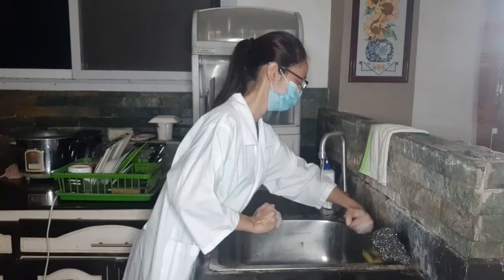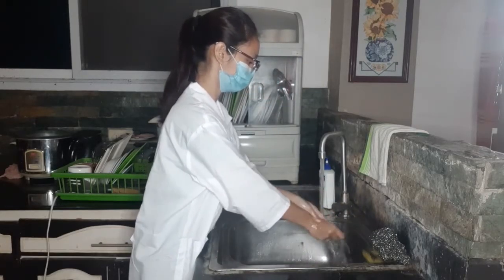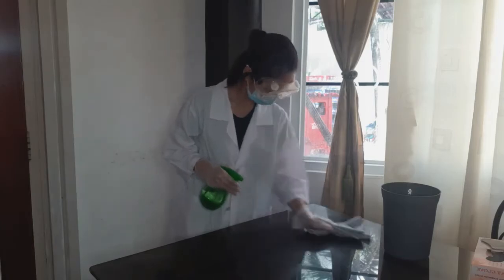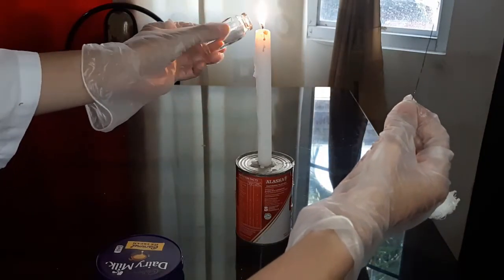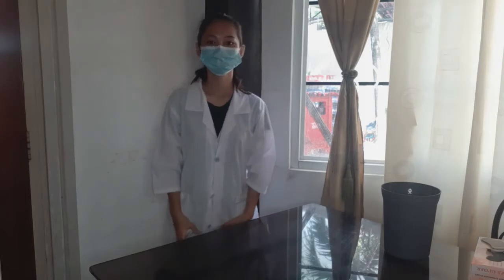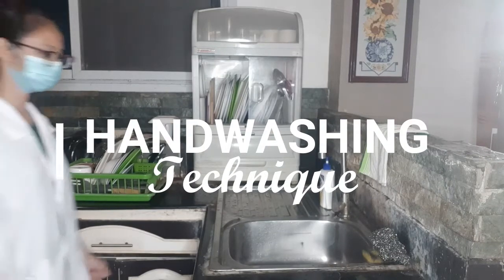Aseptic technique is the transferring or moving of microorganisms from one growth medium to another. Aseptic means without contamination. Literally, a means without and septic means contamination. By using aseptic technique, you can only grow the microorganism you wanted to study without the presence of unwanted microorganisms or contaminants. The first is the hand washing technique.